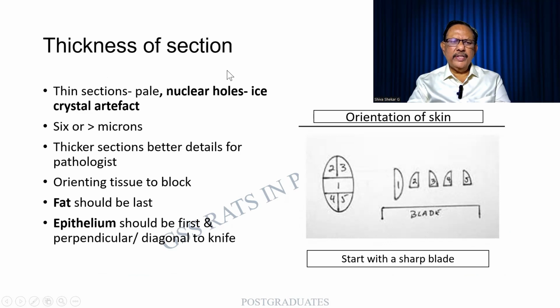The thickness of a section, we had already mentioned. You find that if it is too thin, there can be nuclear holes because of the artifact. And you find that it should not be too thick also. But thicker sections can offer better details to the pathologist because of the ample amount of tissue.